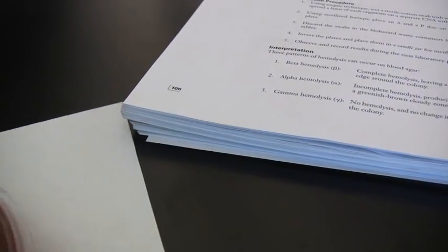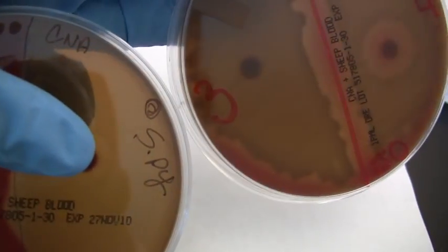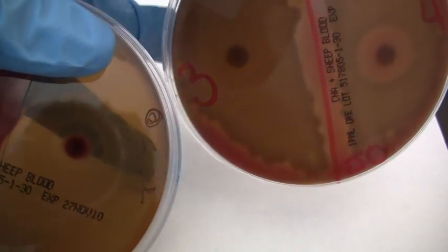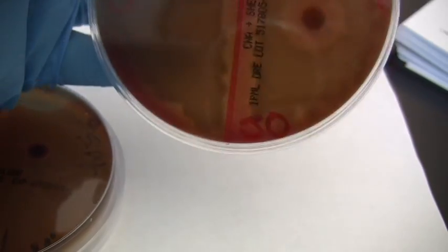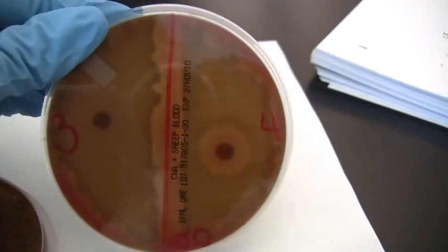So let's compare our alpha and beta together here. So here's my beta next to my alpha. So you should see quite a difference here. And I'm holding it up here a few inches from a light background to really see the difference. So again, with the clearing, I can see all the way through here on my left. On the right-hand side, I might be able to see that there's something behind there, but I certainly can't clearly see through and read through it. This is the alpha hemolysis plate. So both reactions seen on this plate are alpha hemolysis.